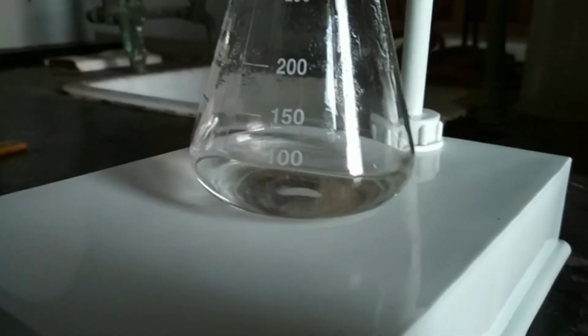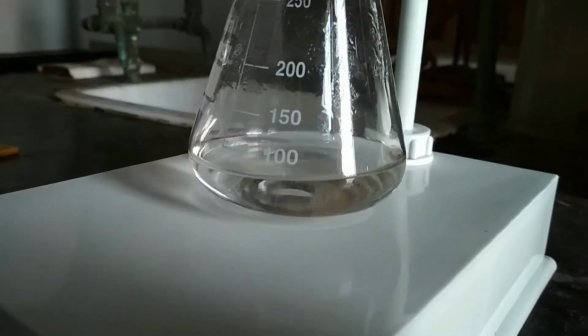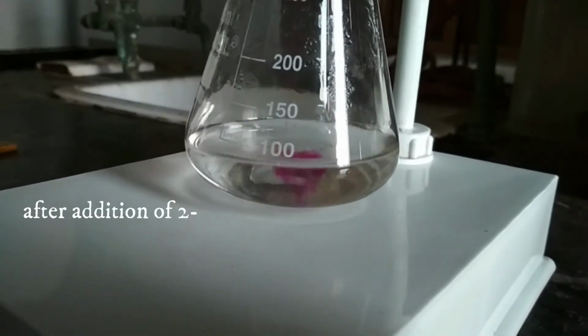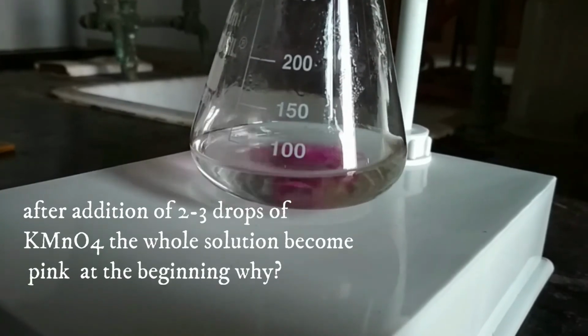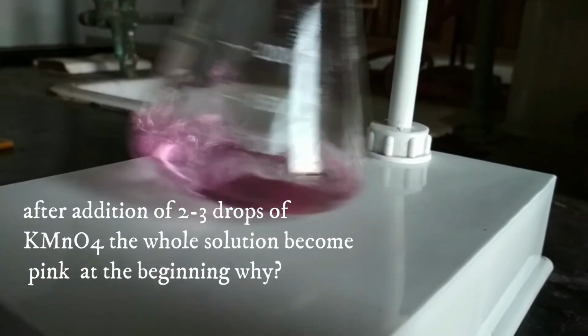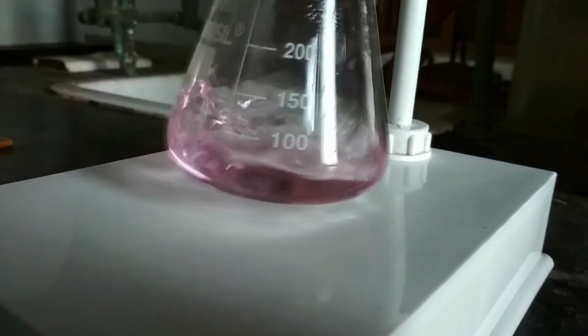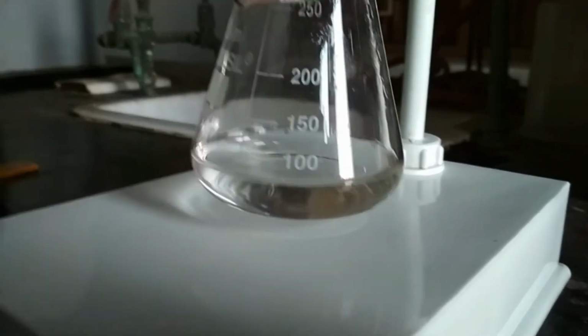Now during the titration, an interesting observation can be experienced: after addition of 2 to 3 drops of KMnO4 to the oxalic acid solution, the whole solution becomes pink at the beginning. But why? It is one of the important examples of an auto-catalysis reaction.